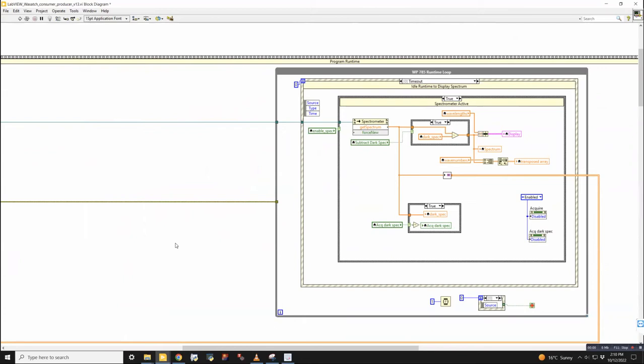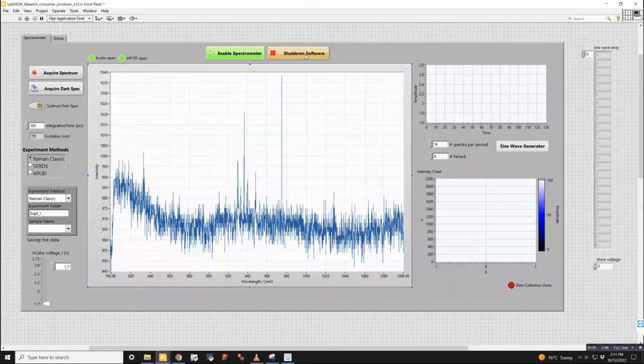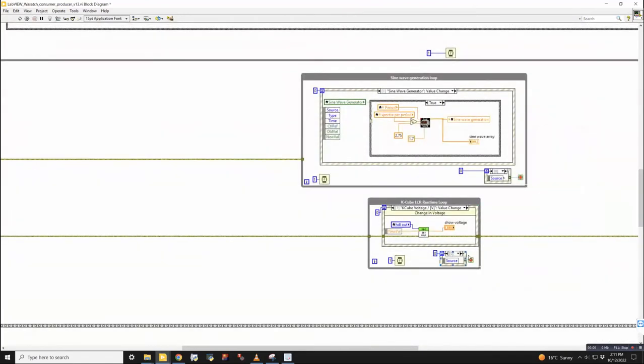So the program runtime is where everything is initialized and the program is waiting for user input. So it'll be running in some sort of default state. Every piece of hardware will be running in at least one loop, usually one loop. So over here, we have the Wasatch Pro runtime loop. This thing will be running forever until we tell it to stop running. So we have a stop button here, which I've pointed to, which is the shutdown software button. And this one will shut down the Wasatch runtime loop, which is shut down by passing a true value into this little stop sign, as well as in this K-cube operations one.